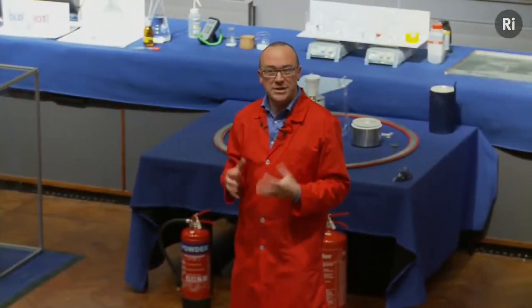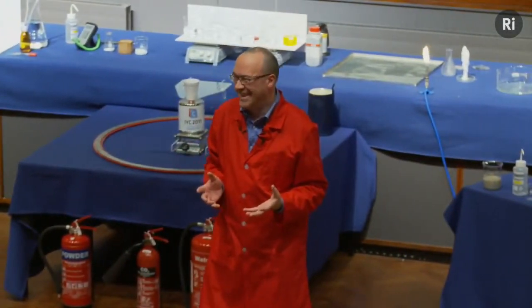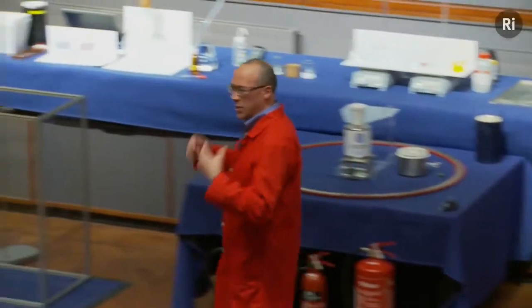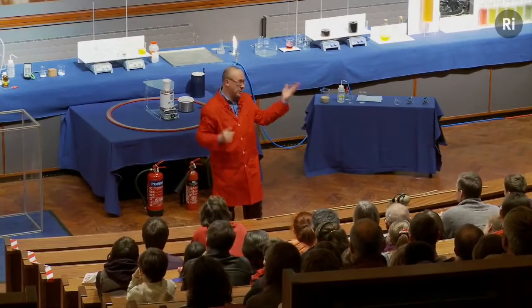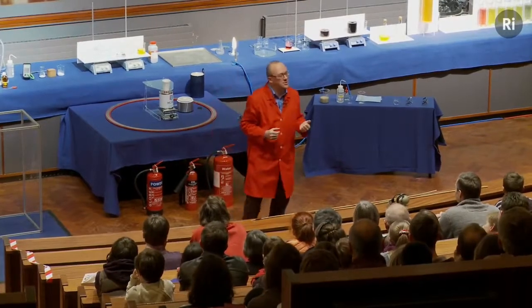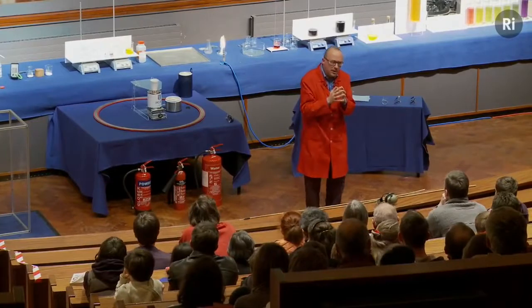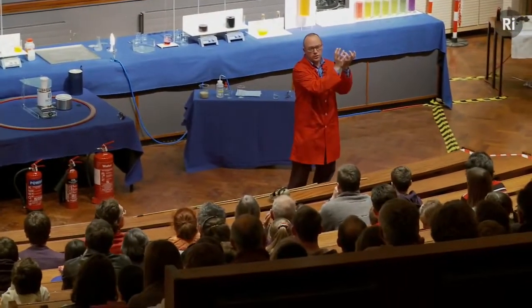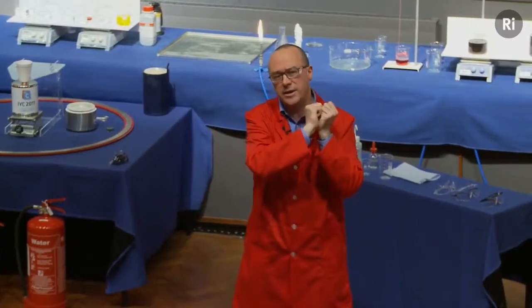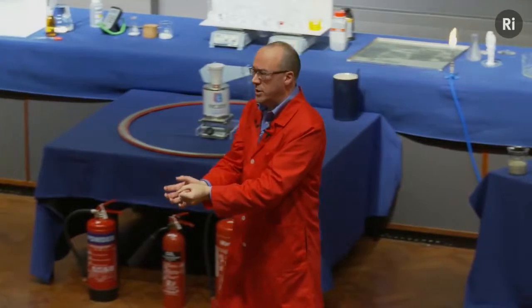So I think you'll have noticed in that reaction that energy was released. Clearly. So we got a lot of noise, we saw the flame, we saw the light, I could feel the heat, and probably you in the front row could as well. So energy was released in that reaction. So what was happening is that the starting material, the hydrogen and oxygen, were in a sort of state of high energy. And as a result of the reaction, they moved to a state of low energy.